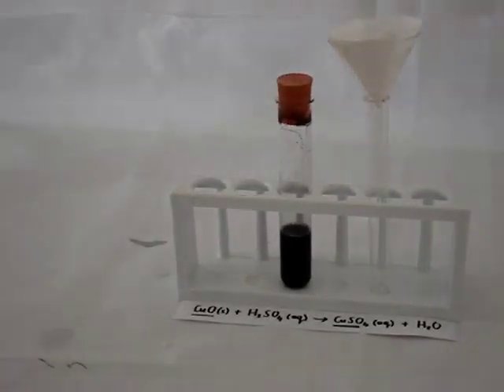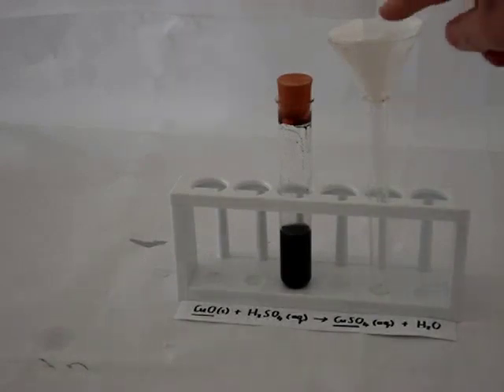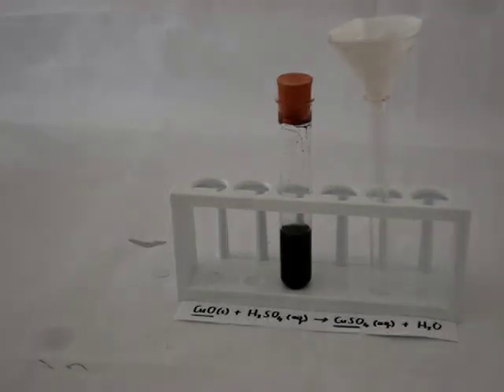Filtering means that we pass the solution through a funnel which has filter paper in it. You can see that over here. The residue will remain behind, in other words, all the material that is not small enough to pass through the small holes that are in the filter paper, and the filtrate will go through.